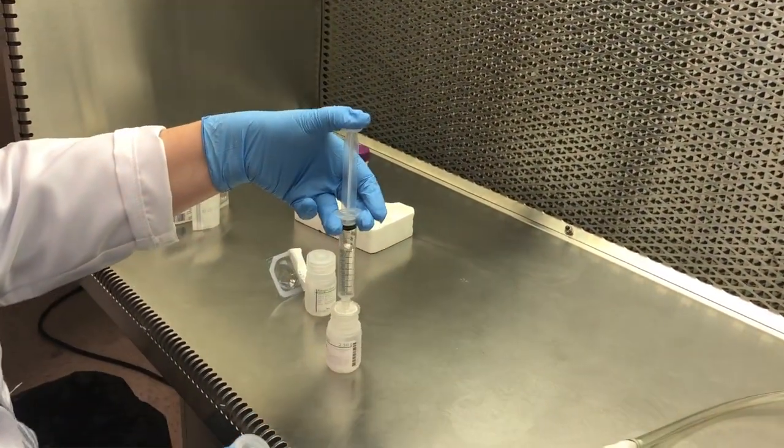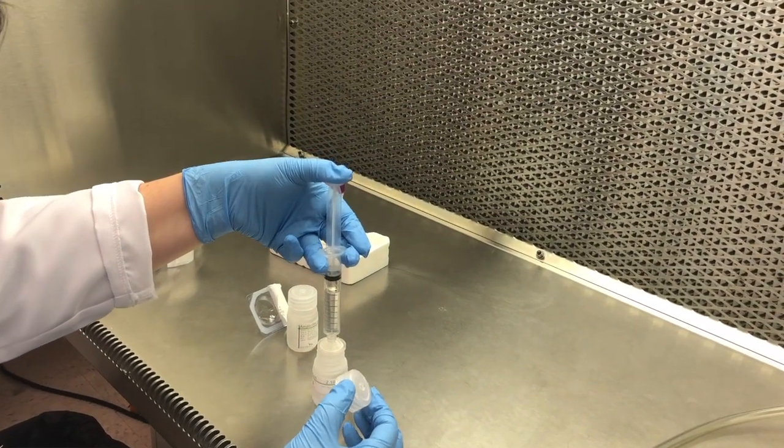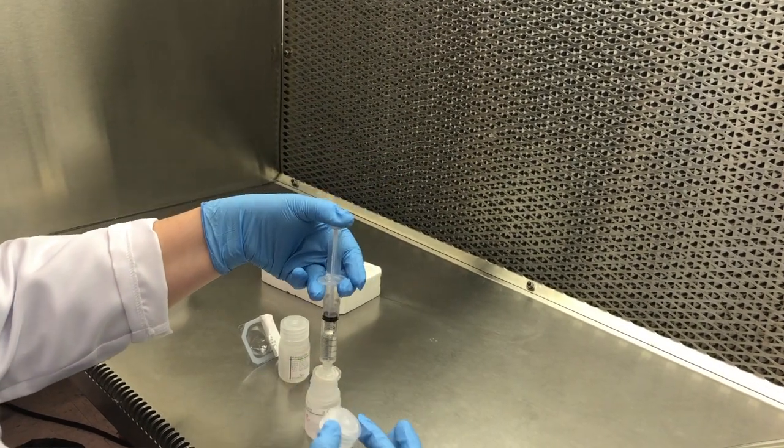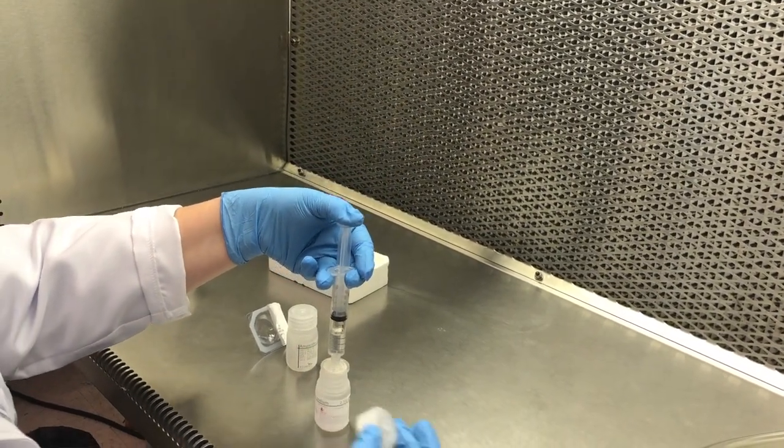Carefully place the tip of the filter over the vial that does not contain any product. Slowly push down on the plunger and allow all of the solution to flow through the filter.